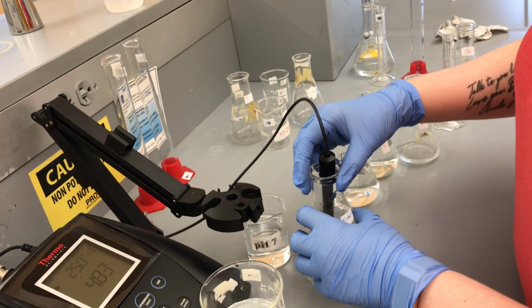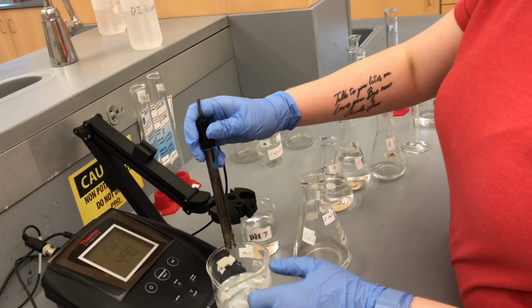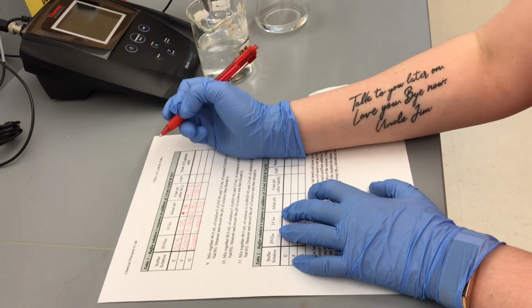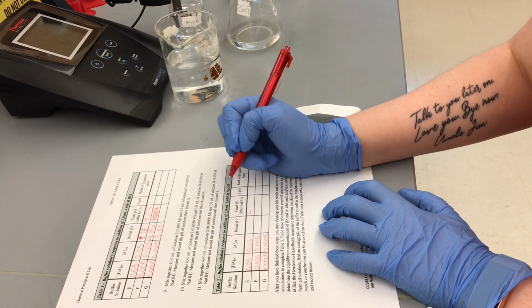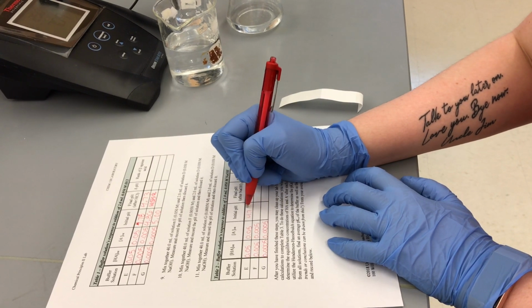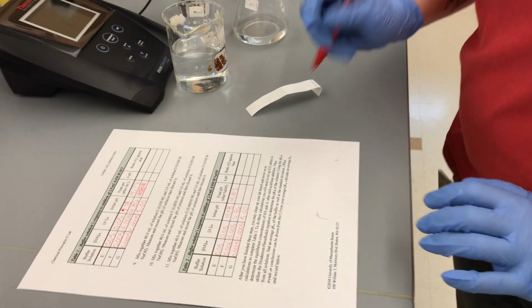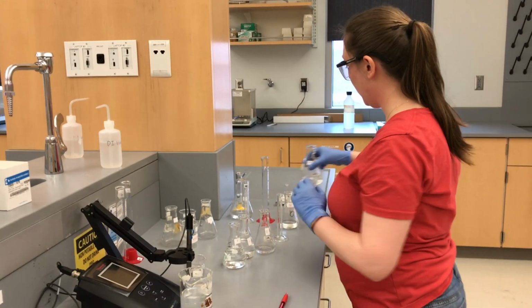So it looks like 4.83 is our reading. Rinse that off. All right. 4.83. I mean, .83. Okay. 5.00. All right, so next we'll move on to F.